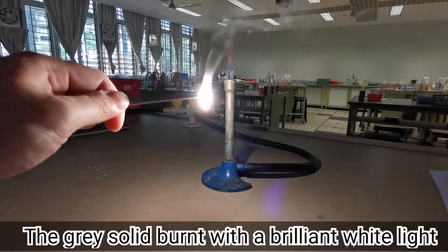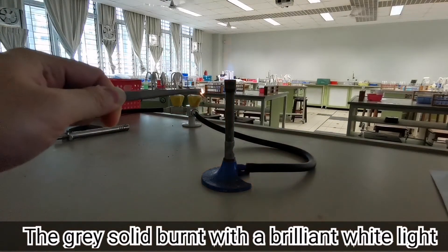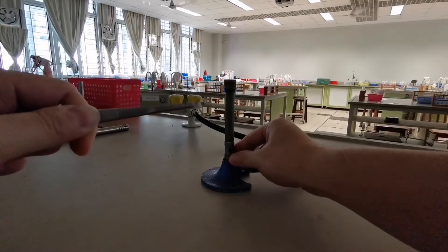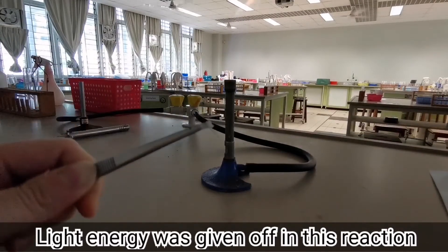Can you see that a bright light was given off as the magnesium was heated over the Bunsen flame? So light energy was given off in this reaction.